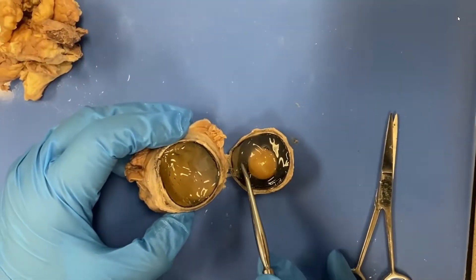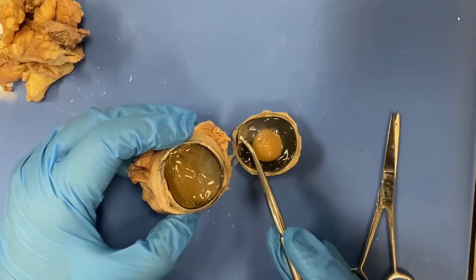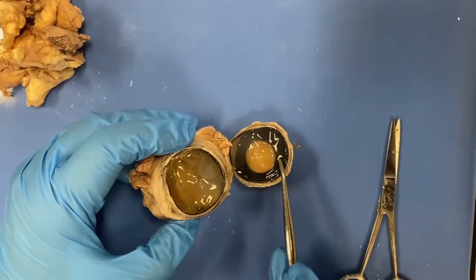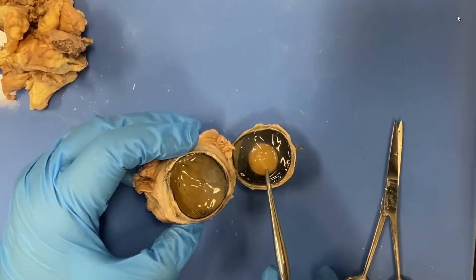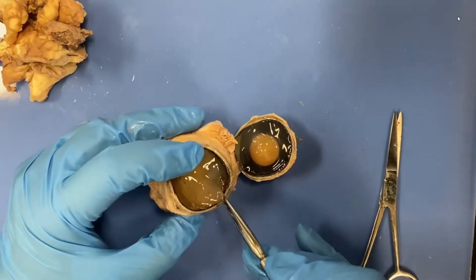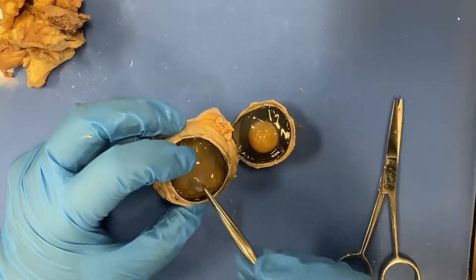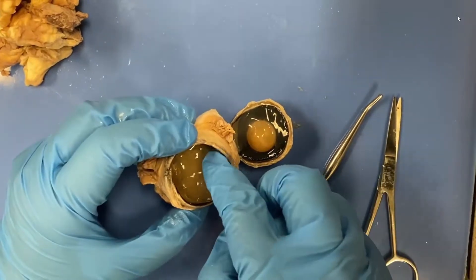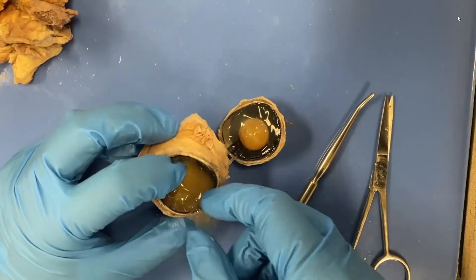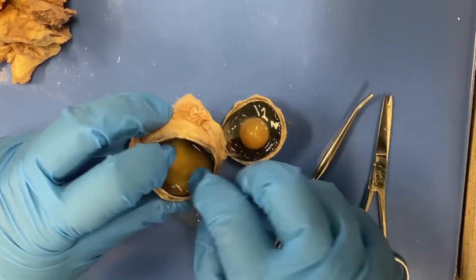I would assume a cow can see, so there's a reason for this. You can see this gelatinous-like material. So if we're behind the lens, we're in a certain cavity — behind the lens, so the obvious name would be posterior. We're sitting in the posterior cavity. This gelatinous stuff right here is the vitreous humor. You make the vitreous humor when you're in your mother's uterus, and it stays with you your whole life. It is crystal clear, and it helps maintain the shape of the eye.